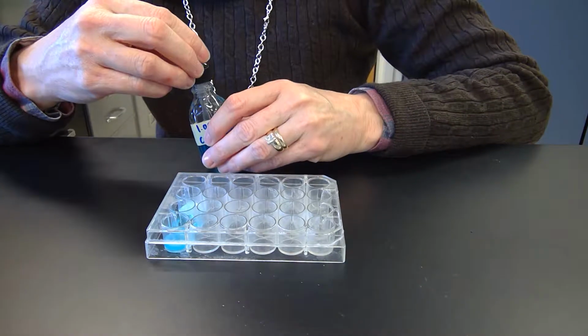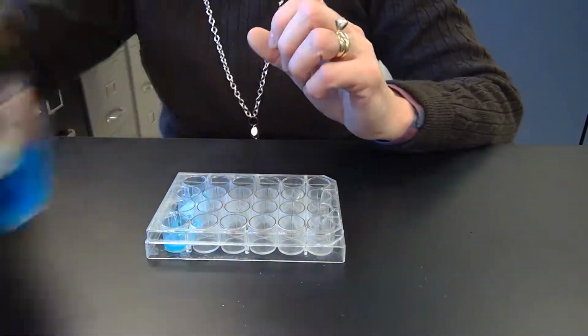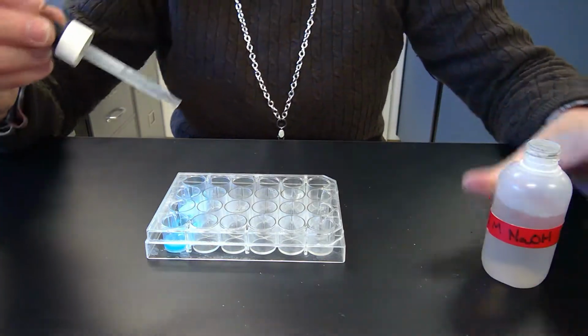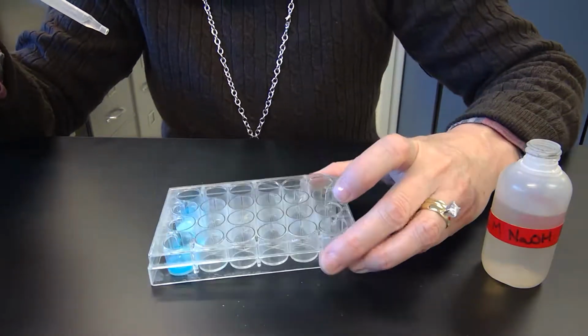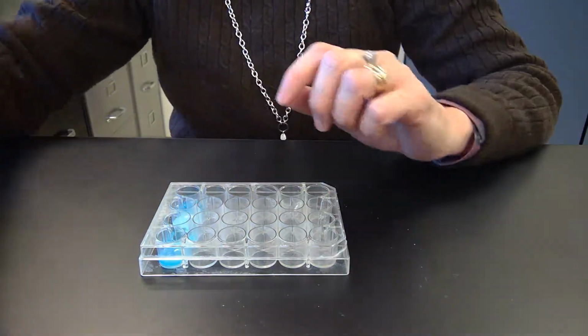The fourth one is copper 2 sulfate again, and then we are adding in sodium hydroxide. So add that in, a squirt of that. Again, it's just clear blue, and then if you can see, it's like chunky whitish, bluish stuff. So those are the first 4.